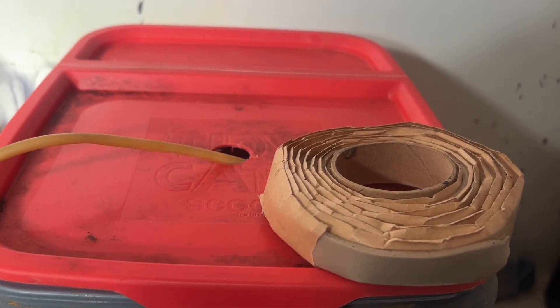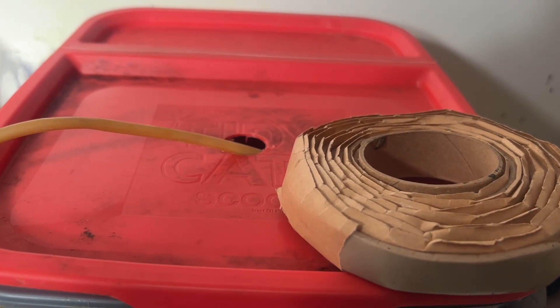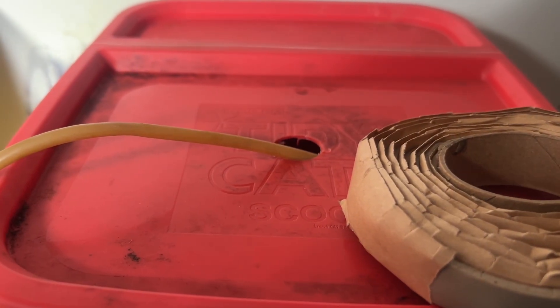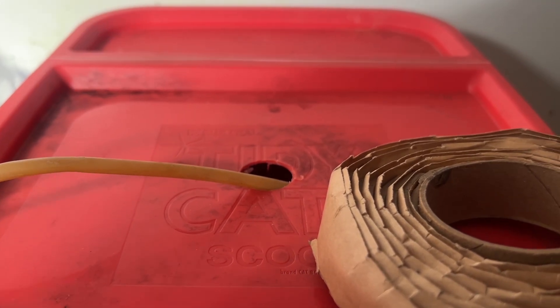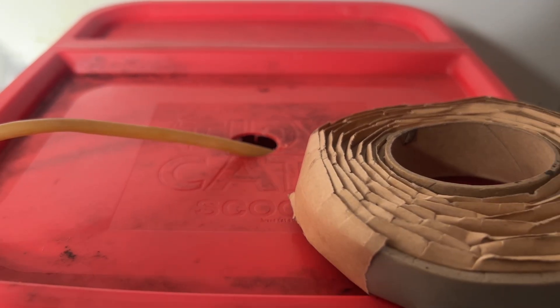We'll be starting this up shortly and check it in a couple of days. I will be using this gasket tape to fill in the hole — not airtight, but good enough to keep the vapors at a minimum. We'll be running our hood to keep the mess a little bit under control because there's so much splash.